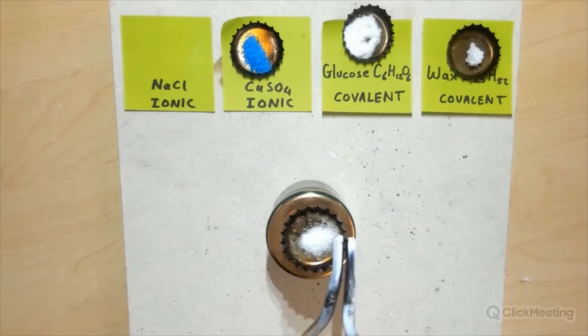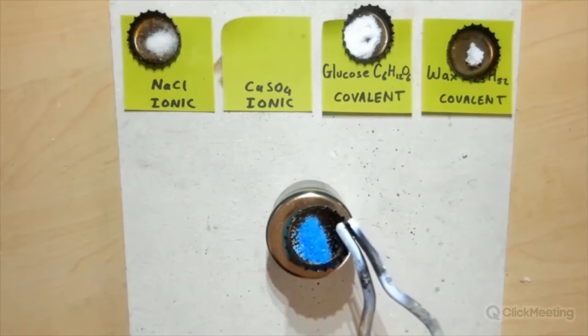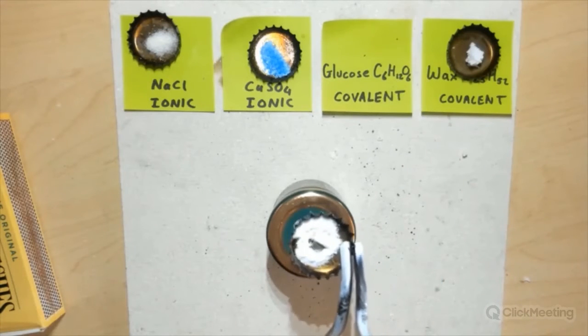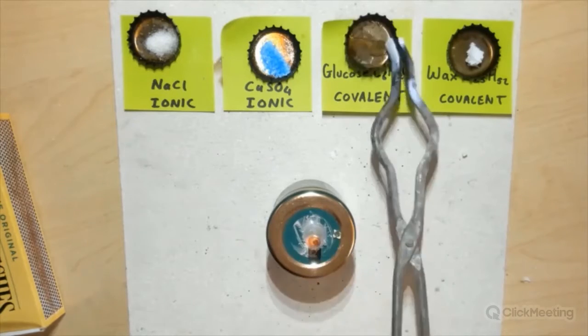I'm just going to pause this. So I've got sodium chloride and copper sulfate, which are ionic compounds, and glucose and wax, which are covalent molecular compounds. I'm not going to cover networks; I leave them to later. But this is a nice experiment that you, or the students, can do, in which you see the ionic compounds don't melt upon heating in a spirit burner. But if you take covalent molecular compounds, such as glucose and wax, they will melt quite easily.